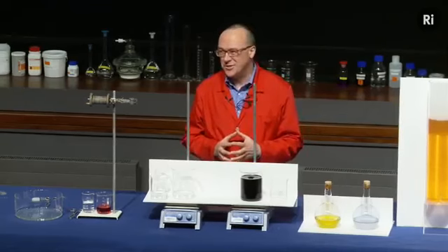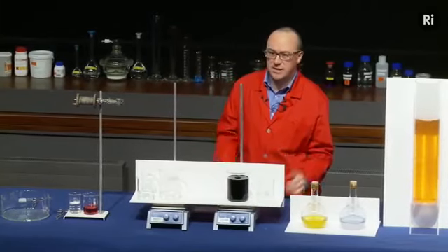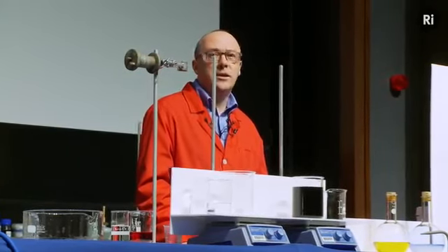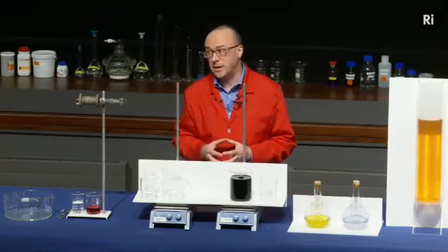Very strange indeed. We mixed the two chemicals and it seemed as if no reaction took place. It just sat there for 10 seconds and then suddenly it reacted. Now that seems very odd, very surprising. But what was really going on? What was really going on is that there were actually two different chemical reactions taking place inside this beaker.